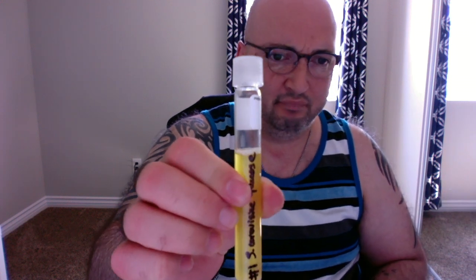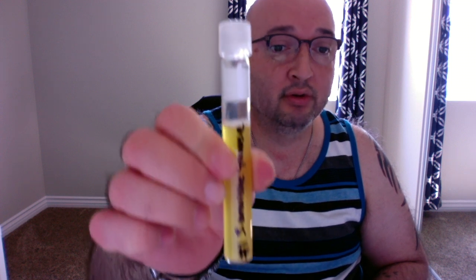Before I added sugar or any of the bacteria, its pH is around 7, so it's neutral. So the red in and of itself does not indicate any sort of acidity. Again, the S. cerevisiae glucose is a fermenter with gas and with acid.